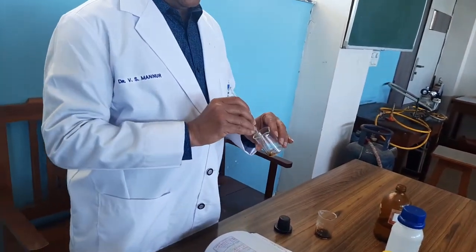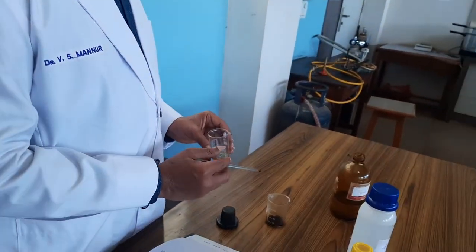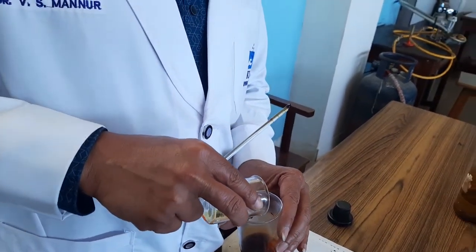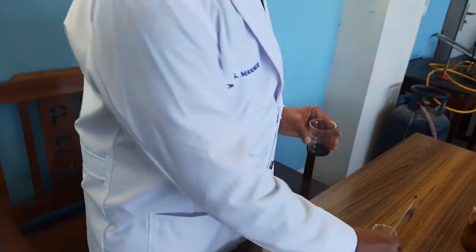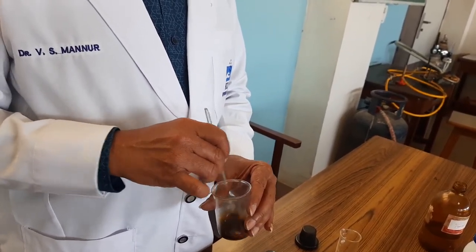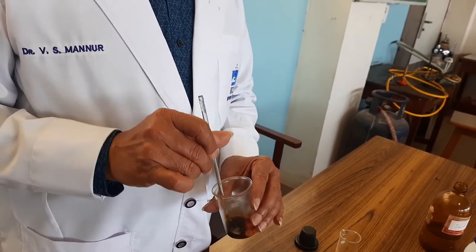Now mix it uniformly so that it forms a uniform solution. Now add this solution to the solution of potassium iodide and purified water, and stir for a few seconds until all the peppermint oil in alcohol is uniformly mixed in the preparation.